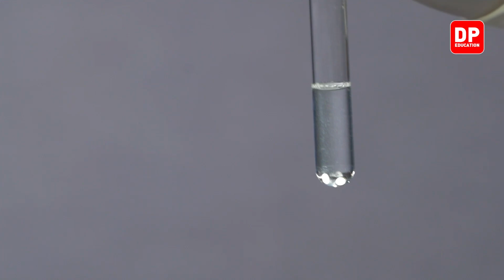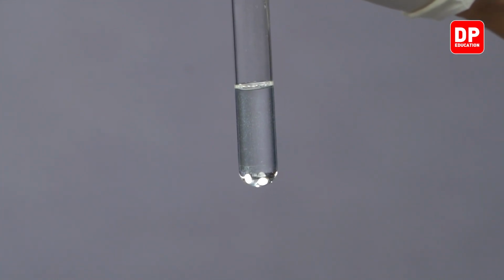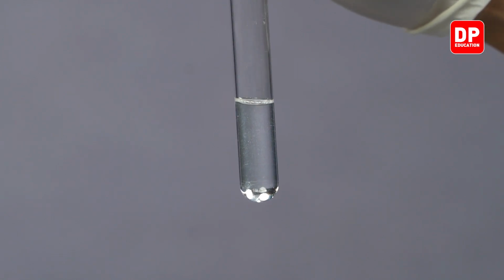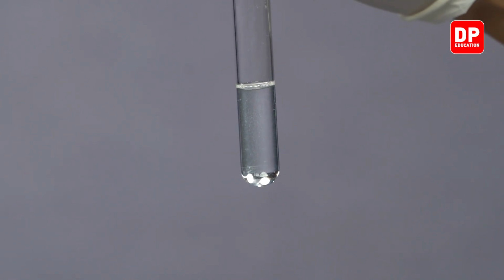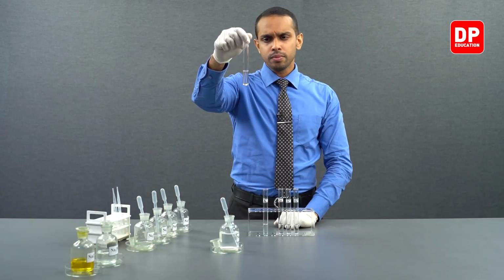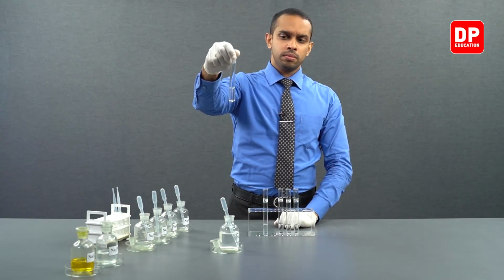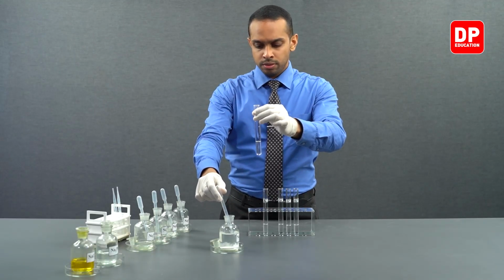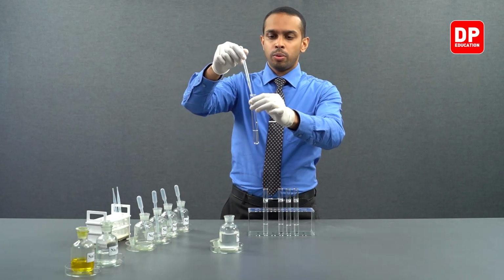If you observe very closely, we can see the formation of fine magnesium oxalate precipitate particles in this solution. We will mix it up a little bit more and add a small amount of sodium oxalate again.